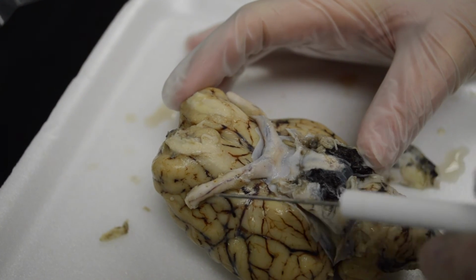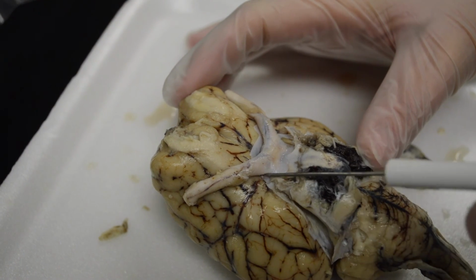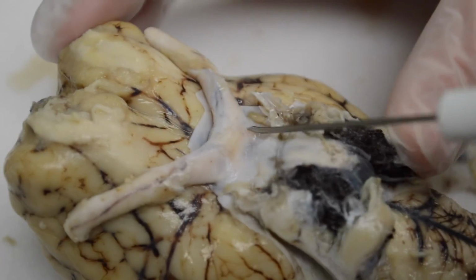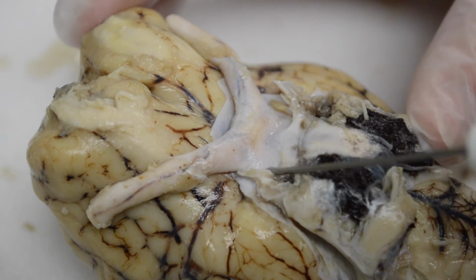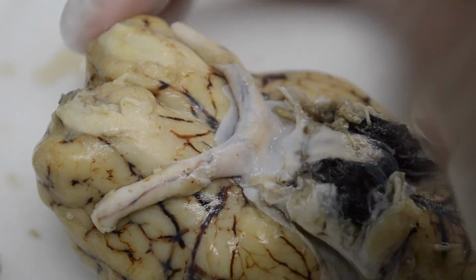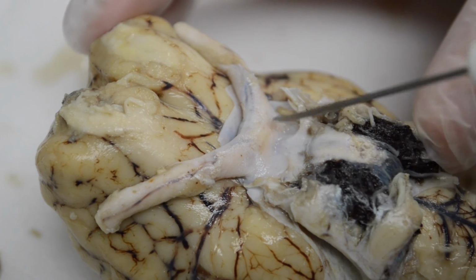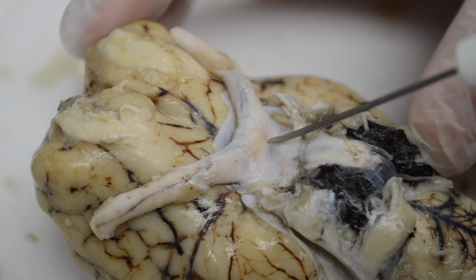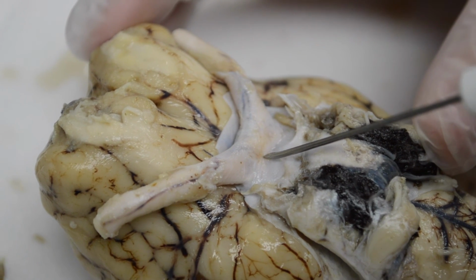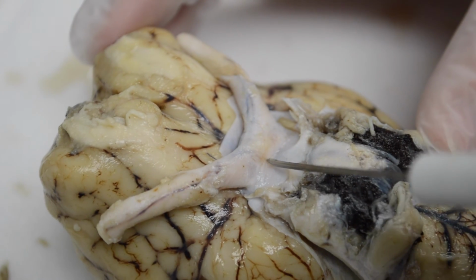These long structures are the optic nerves. And if you notice very carefully, right here, they crisscross. So this right one will come in, because we flipped it over, the right one will come in and cross, the left crosses. And where it crosses in the center, where the two optic nerves cross, it's called the optic chiasm.